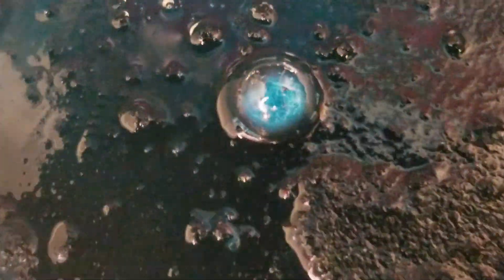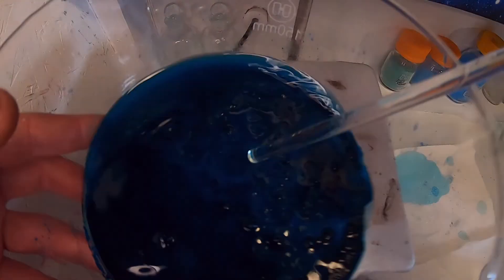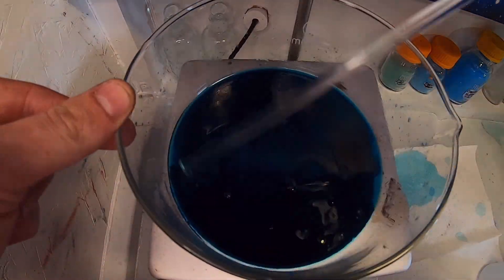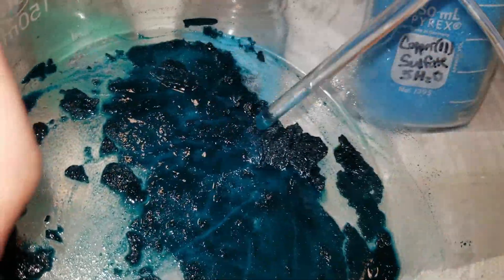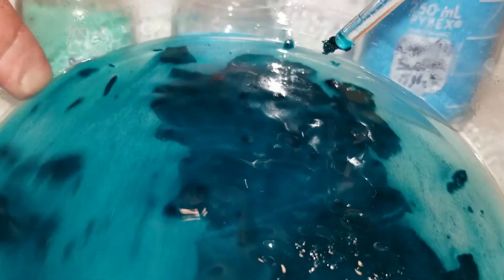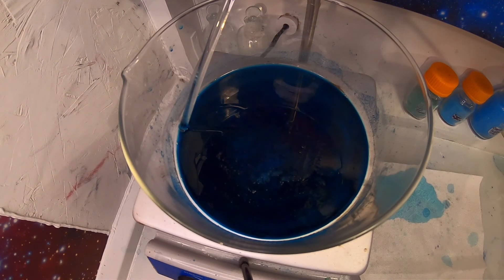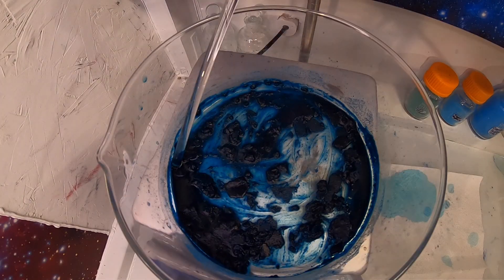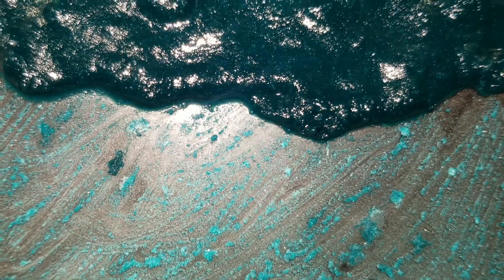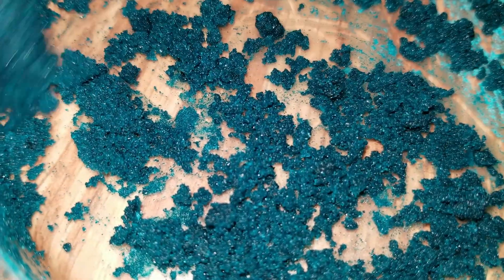In the meantime, check out this cool bubble that formed during evaporation. Next, a small amount of water is added to really loosen the crystals. This camera really makes this compound look very blue. I have included video from a different camera showing a more true color, with compounds in the back for color reference. The crystals re-dissolved and had to be evaporated off once more, this time with much lower heat and more stirring. Once it was nearly evaporated, the crystals were removed from heat. They became a really cool blue-green gooey slushy mess of crystals. Finally, after a bit more stirring and time, I was left with the dry copper acetate I've been after.